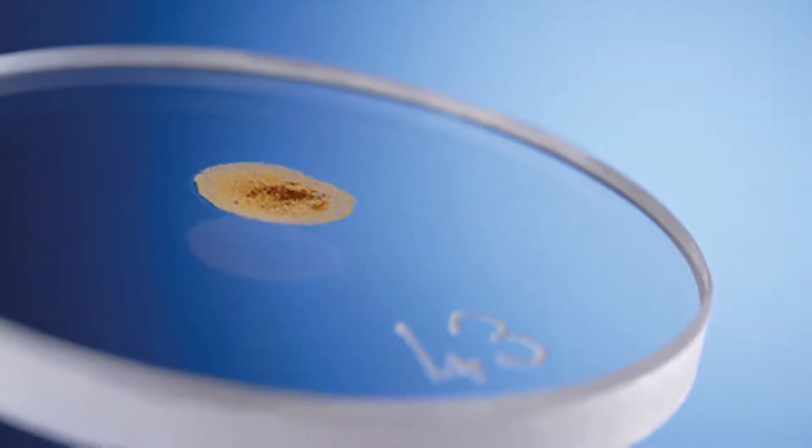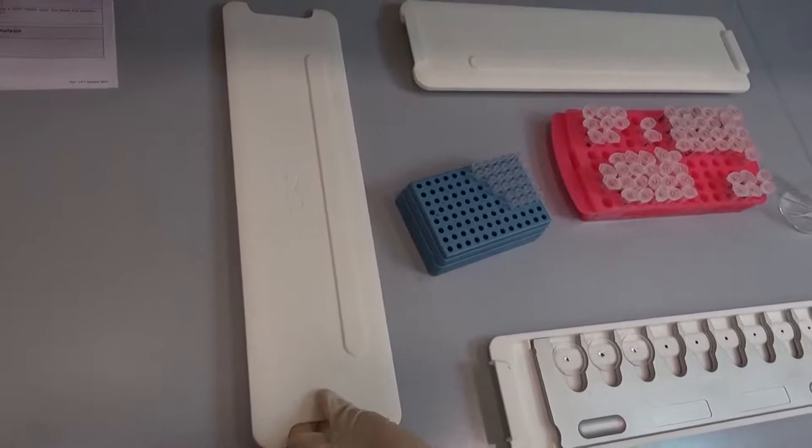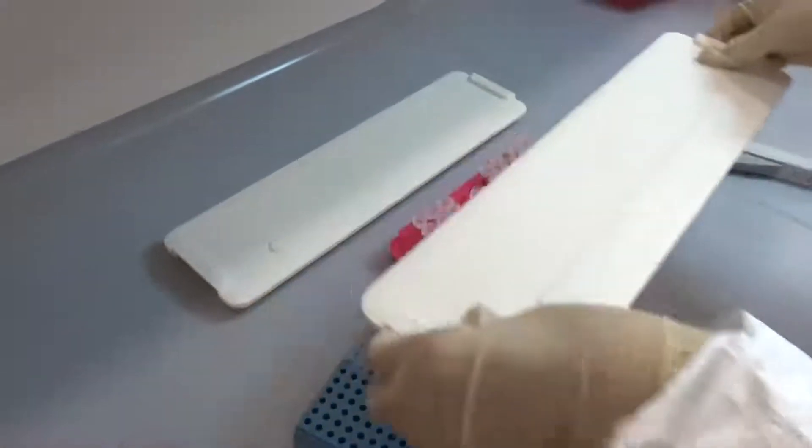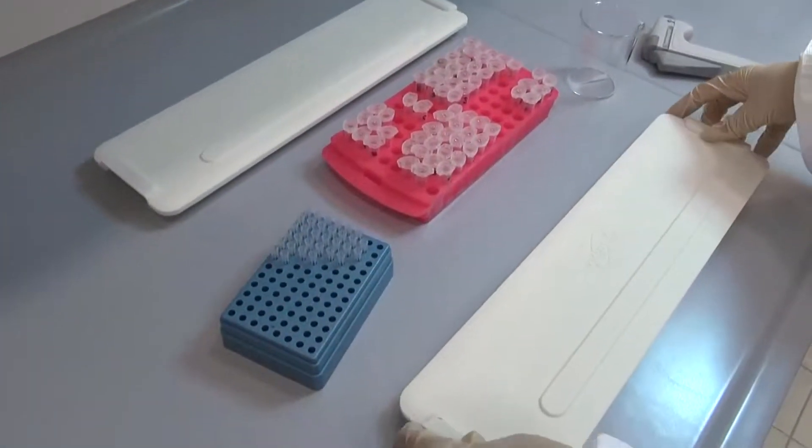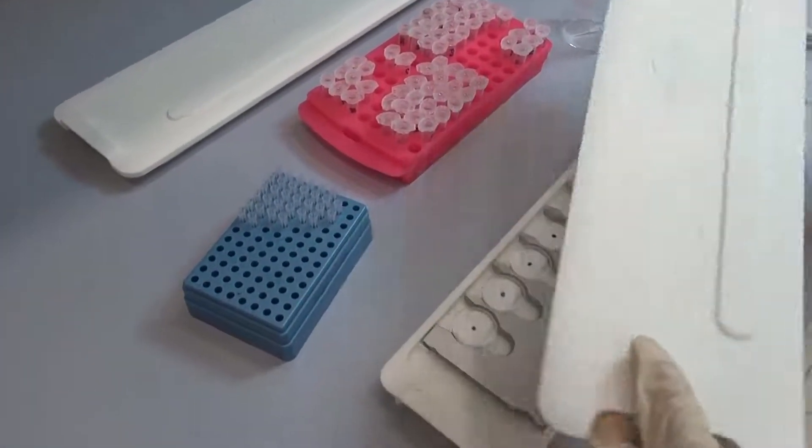Samples have to be prepared on a reflective carrier, for instance on quartz discs. Trays holding the discs are safely kept in a storage box without risk of contamination. The box is taken to the workplace and the cover is removed.